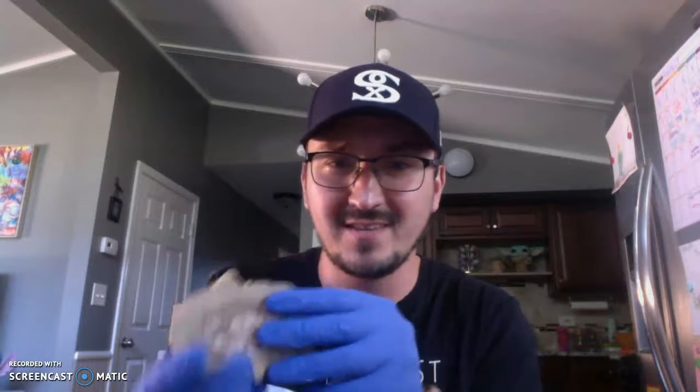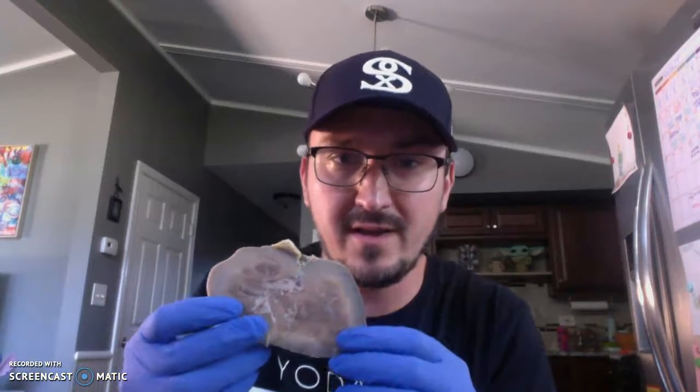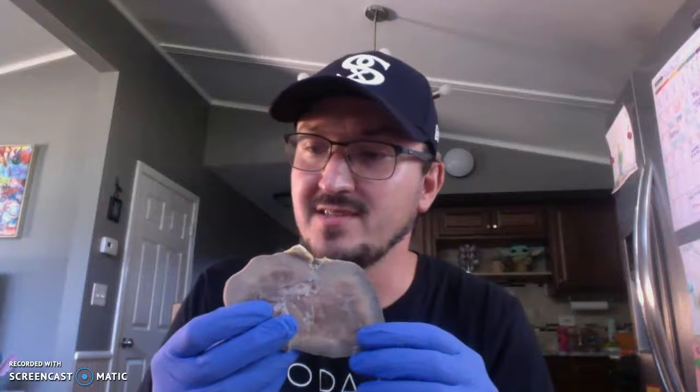I had a hard time seeing the rest of the section, so I actually sliced this a little thinner. When I sliced it thinner, you could actually see the renal pelvis, which is here, and then the renal sinus, which is right in here. And the renal hilum is this little groove here. There's adipose tissue — a lot of fat tissue surrounding. And that's actually the ureter coming off, which goes down into the urinary bladder.